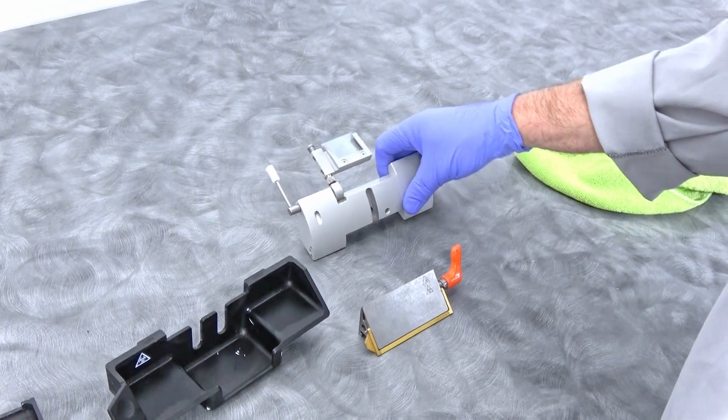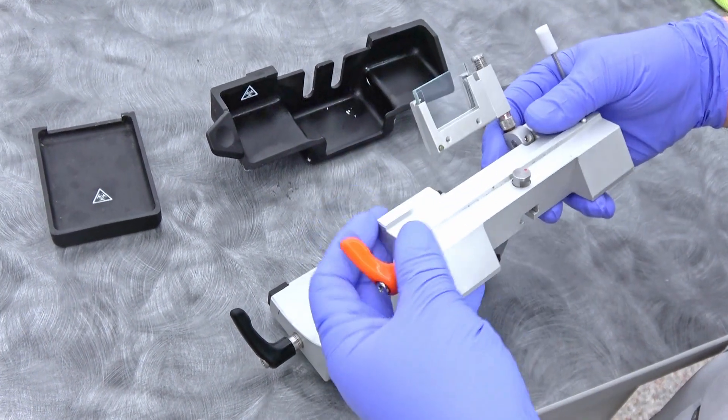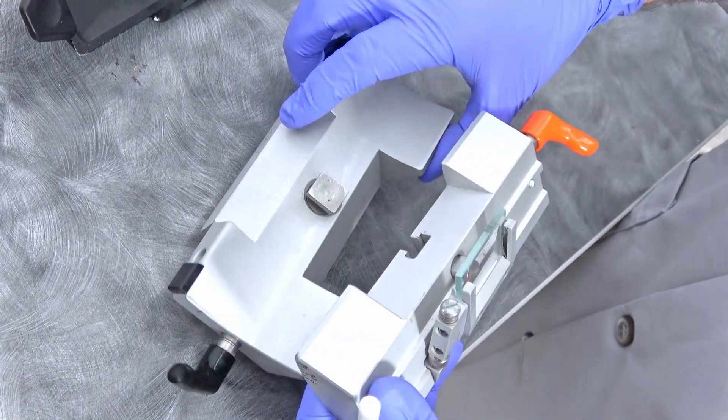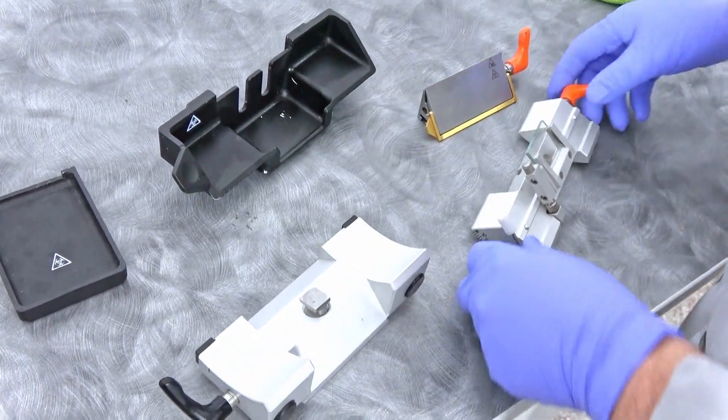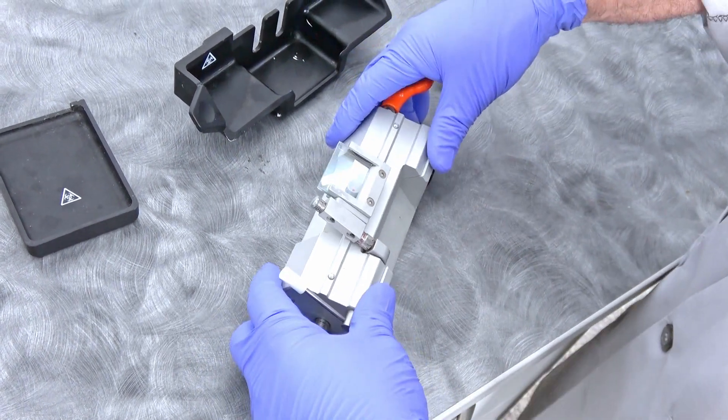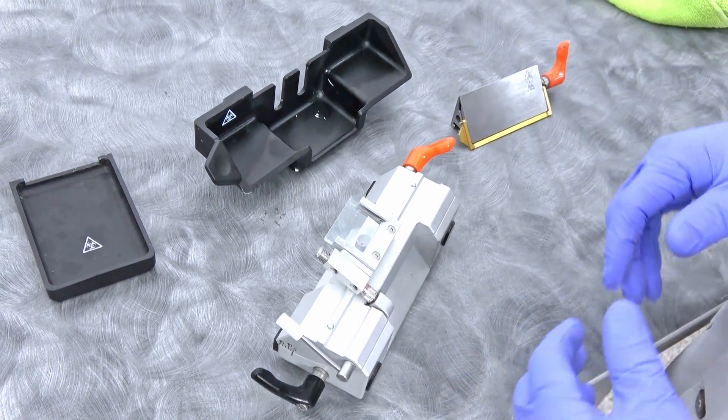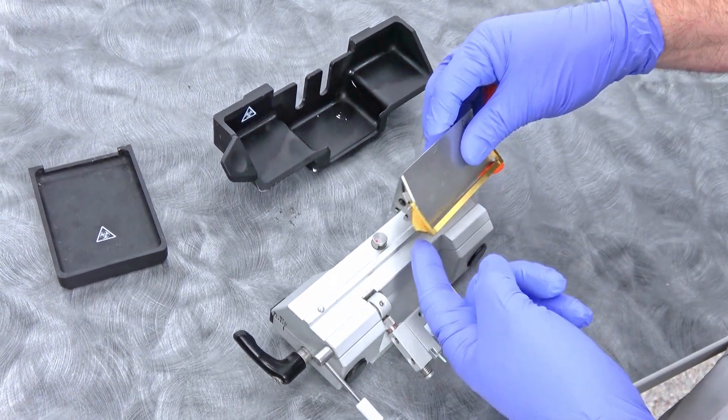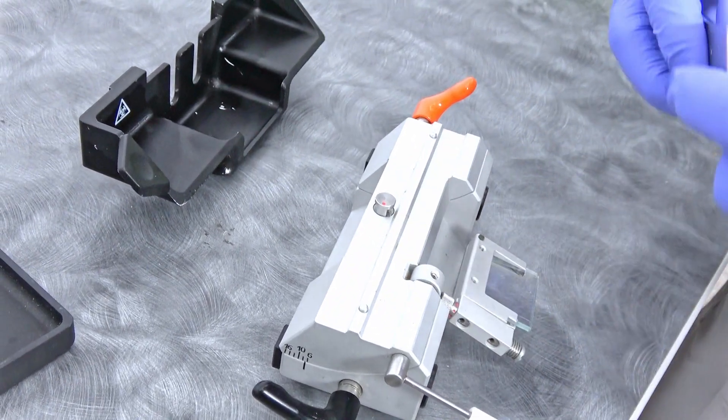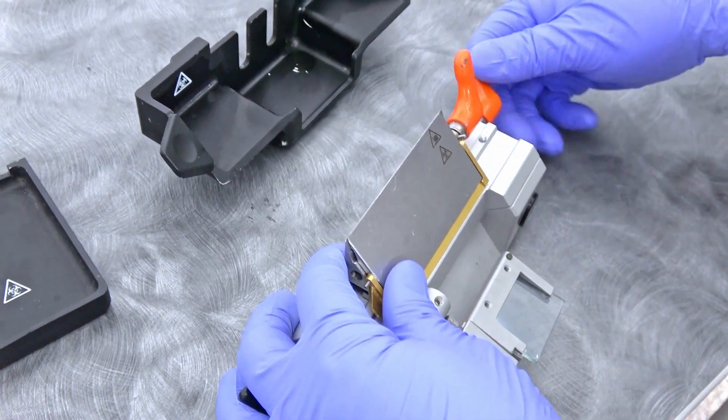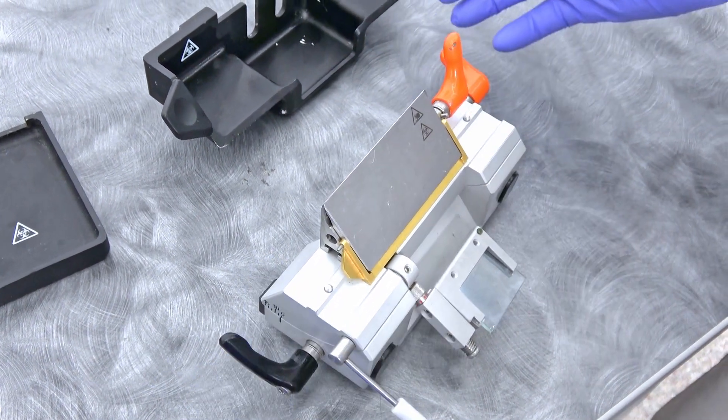Ideally you would not want to put that... we're just going back. You can see the slot here and the notch, so that just slips right in there. This is you know pretty wet so I just had this machine running, so I'm going to have to wait and let it get warmed up a little more and re-clean it. But for the video's sake I want to make sure you see how this goes back again. You can see this is the same way - it has a slot that slides into this slot here. Slide it right in like that and this is what tightens it there.